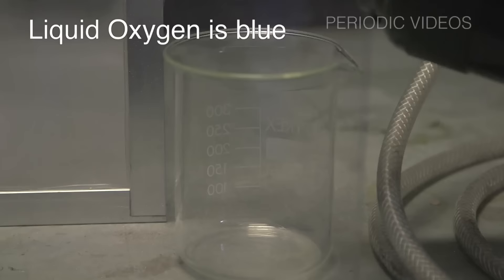But you can't really see that from top because you're looking through liquid oxygen. So, we decided we needed to do another experiment, looking at this vessel sideways. So, you could see the liquid, and at the same time, you could see the iron at the bottom and see what was happening.